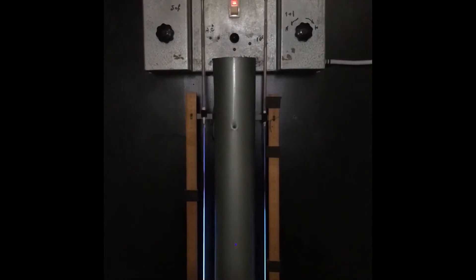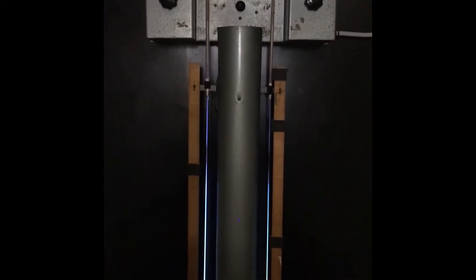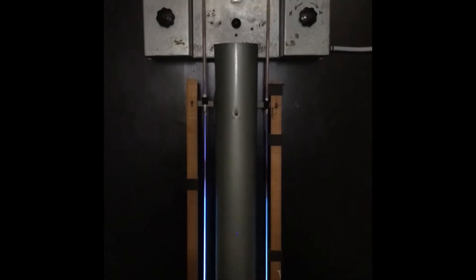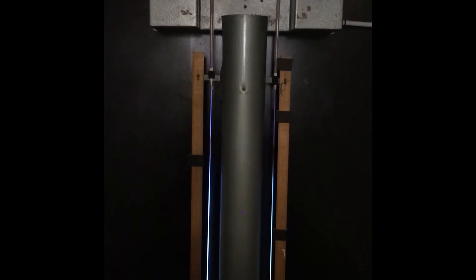The method is running — it takes nearly five hours. Right now I think there are two or three hours remaining. I want to show you the colorful rings. You can see the red area here and the yellow area below it. As I mentioned before, at the end of the method we will calculate the heights between these colored zones and report that as a volume concentration percentage.